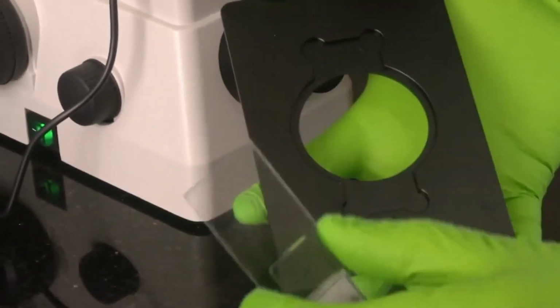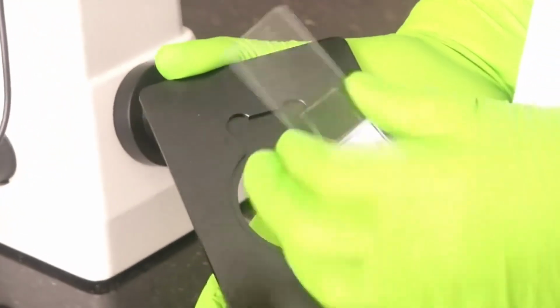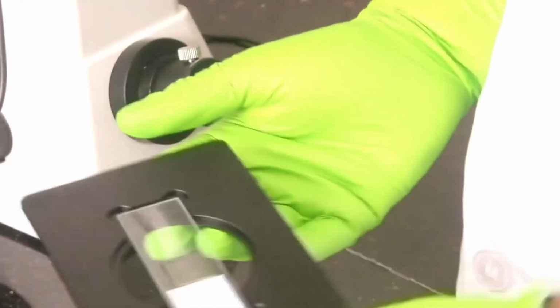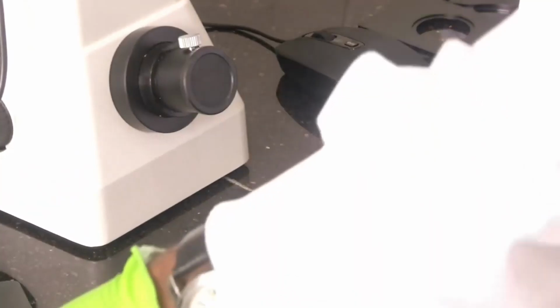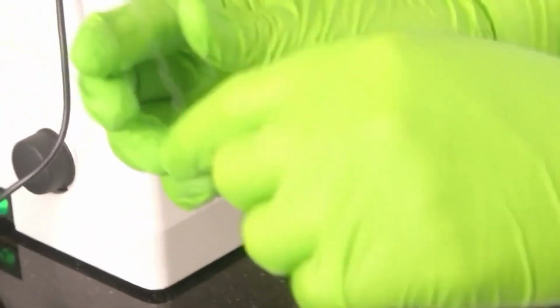So the slides, usually biological specimens are, if you take blood, if you have gone to hospitals, in olden times what they used to do, they used to prick your finger with a needle and then ask you to swipe it on a glass slide like this.